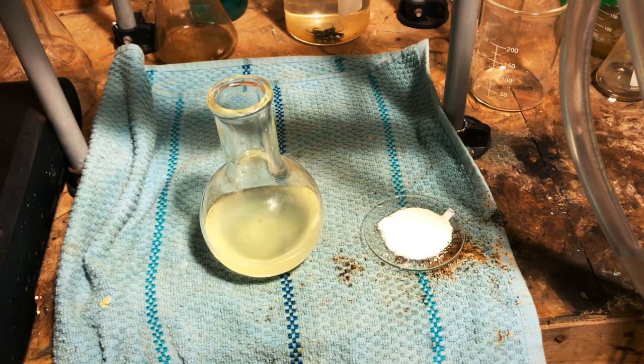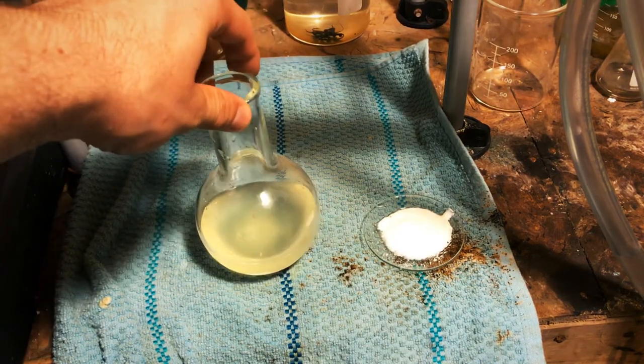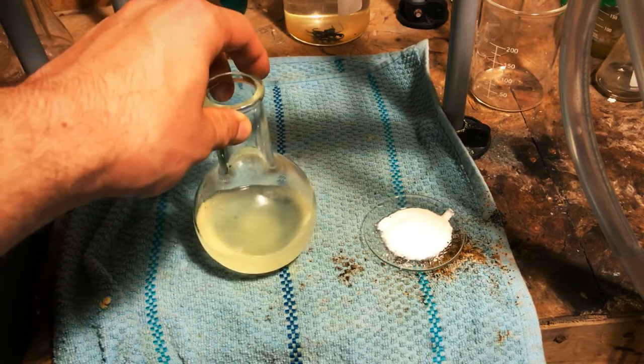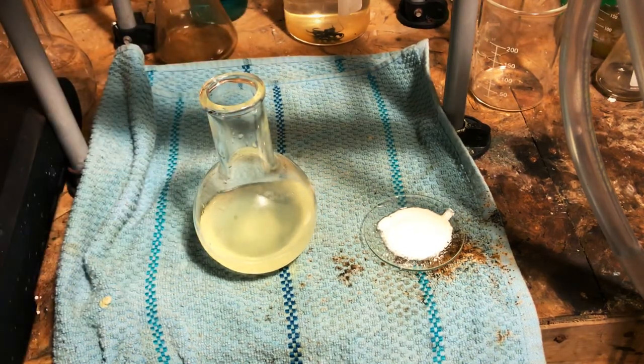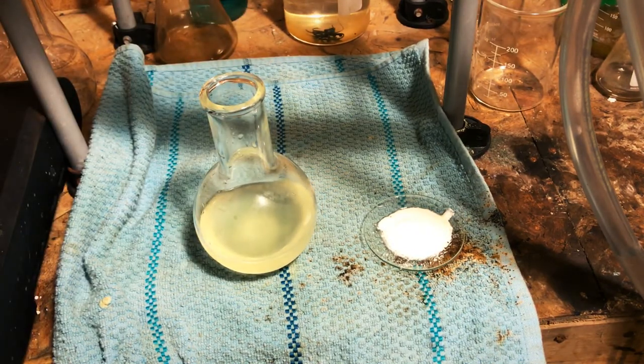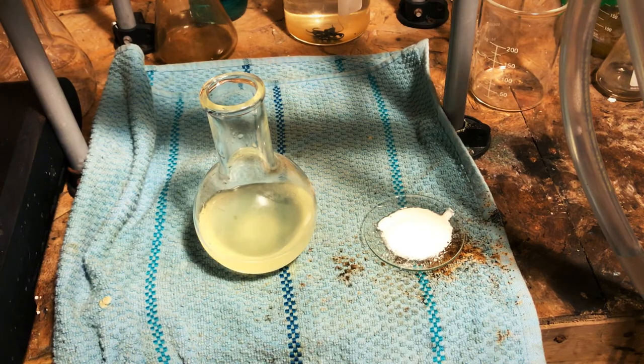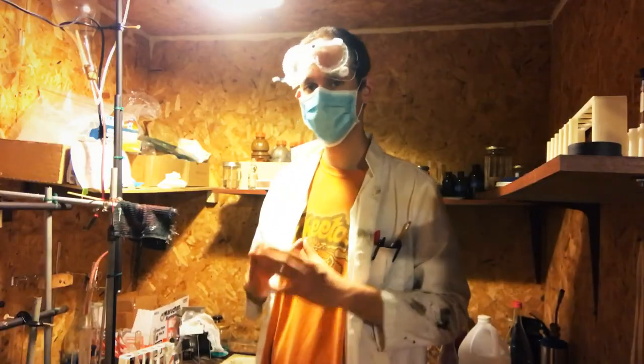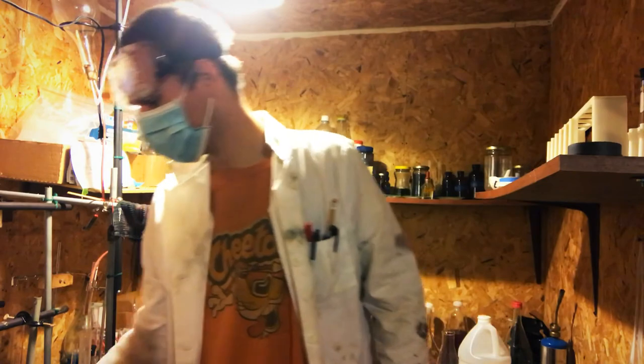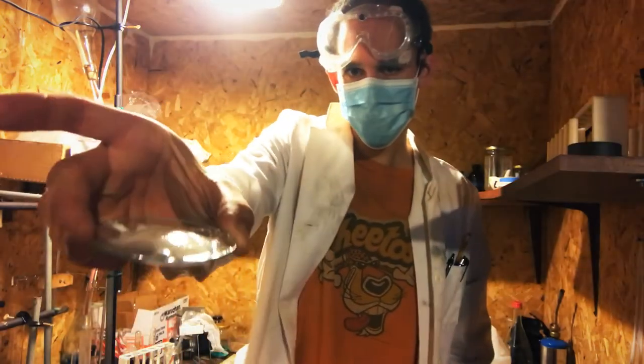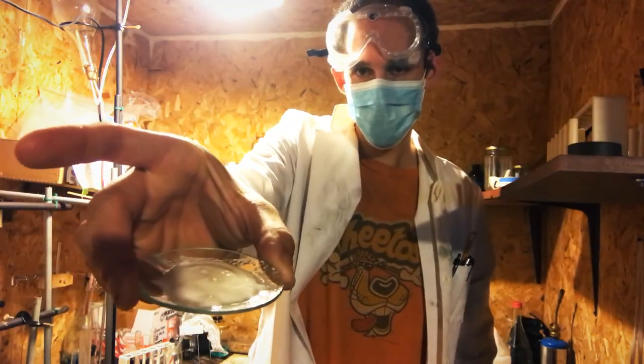We have a solution here on the left in this round bottom flask. This solution contains minerals, vitamins, lactose, and whey. I have demonstrated how to extract the protein casein from milk.